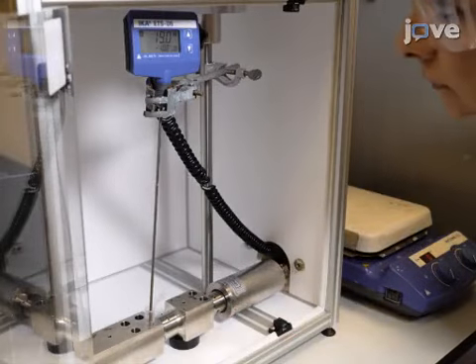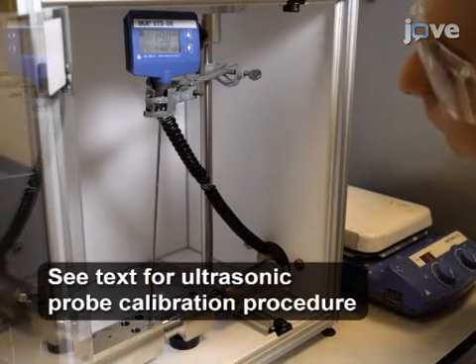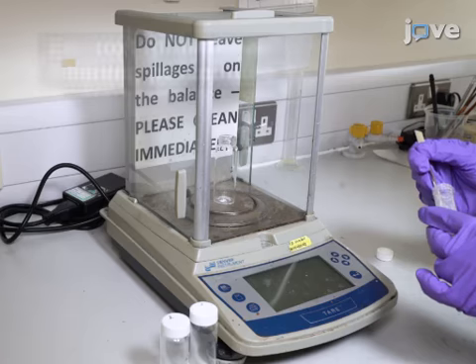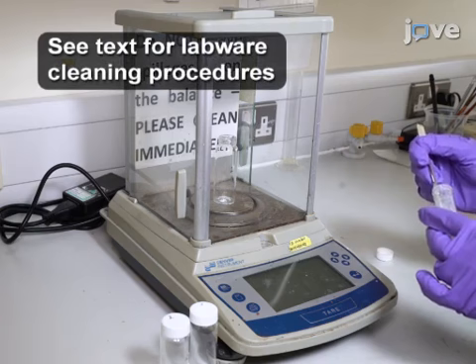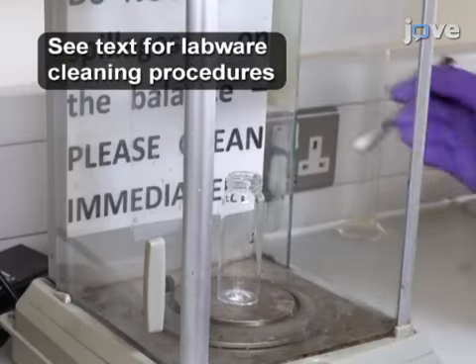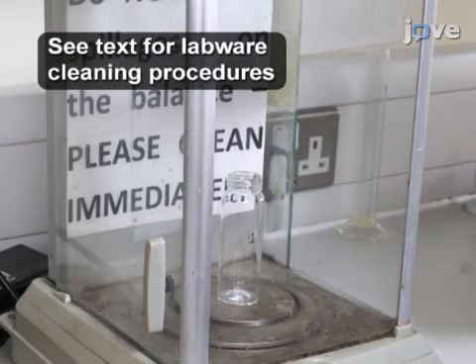To begin the procedure, calibrate the probe sonicator fitted with a vial block sonitrode. Then, use a clean metal spatula to measure 2 mg of the chosen nanopowder into each of 3 clean 10 or 20 ml glass vials numbered 1 through 3.